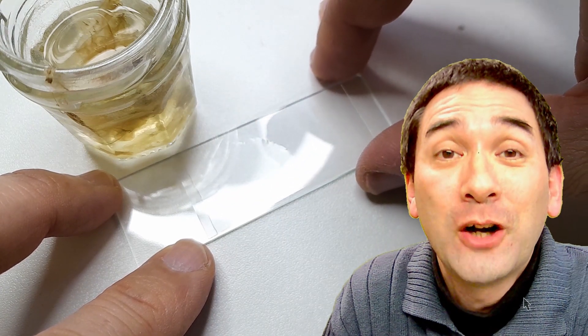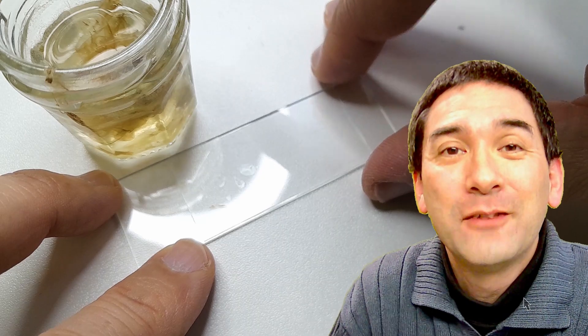Cover glass goes on top. I like the large cover glasses because they keep the evaporation low. And what are you able to see there? Okay, so let's have a look.